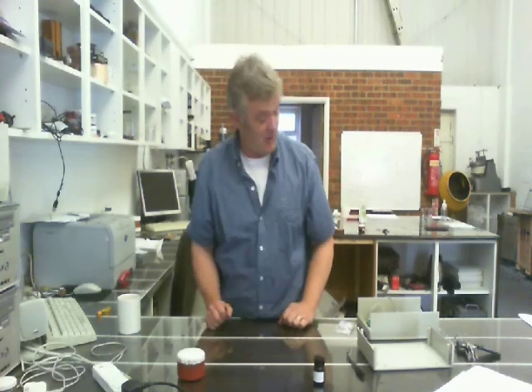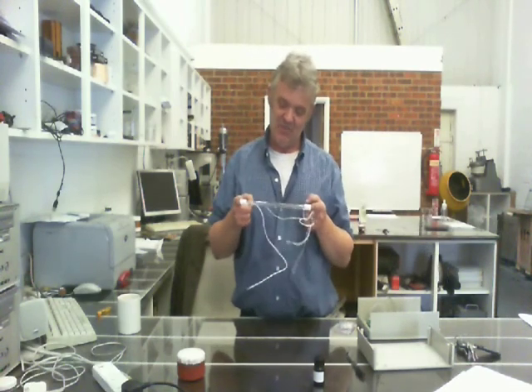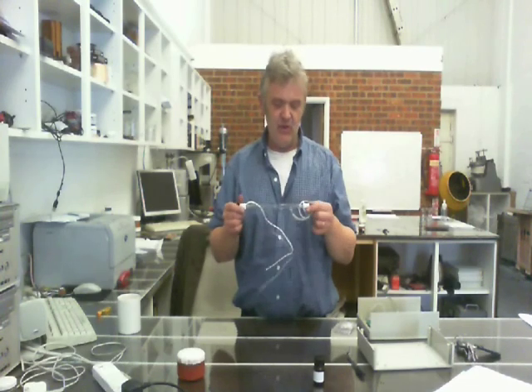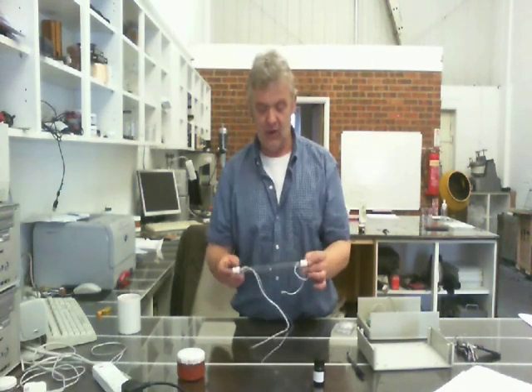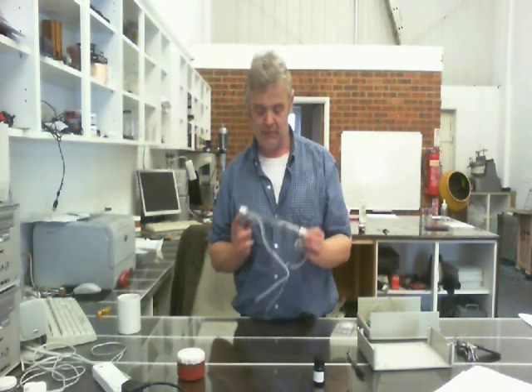Now, obviously, in order to do that, what I need is a high power flash lamp. And a high power flash lamp is surprisingly not that easy to come across. But the bits to make it are quite easy to come across. What you need is one of these. This is a high-power xenon flash lamp bulb, 750 watts. And if we can drive that and make that flash across our graphene oxide, across our copper oxide, we're an absolute winner. Now, I got that from eBay, actually. It came from Israel, and I think it cost me £25.